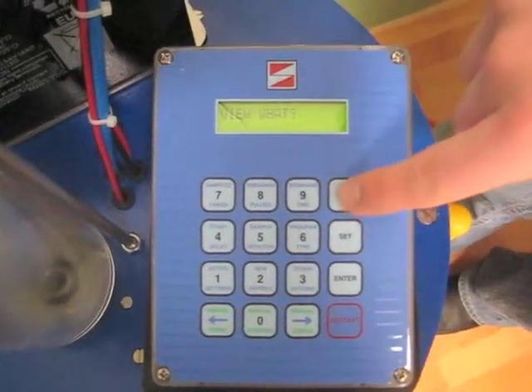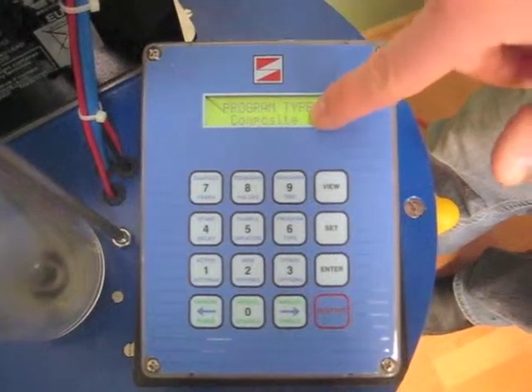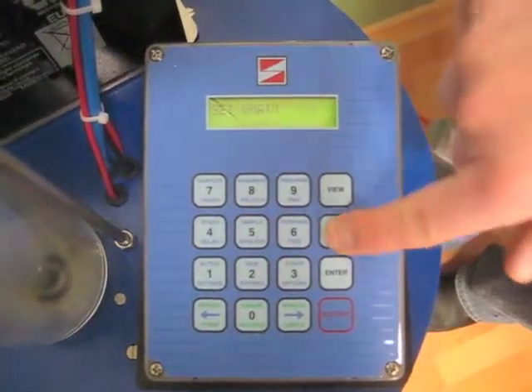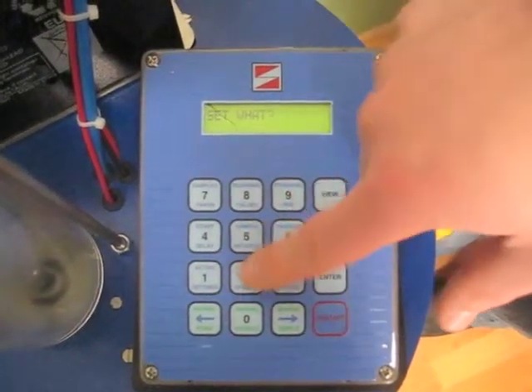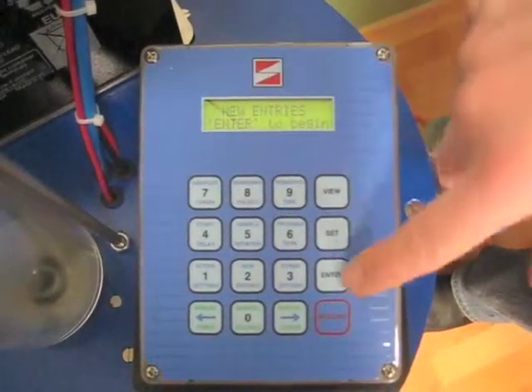You can view your current settings, view program type and you can see that it's set to composite. You can also set program type or you can set all of them and press new entries. Here it says new entries, enter to begin, so you press enter.